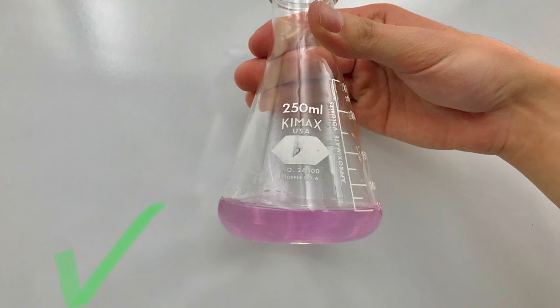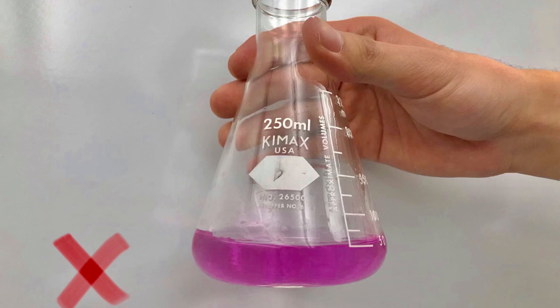The brighter the tint, the further the pH is from neutral, so this product would give you a poor result.